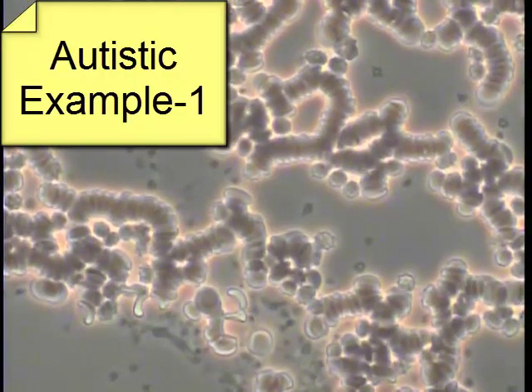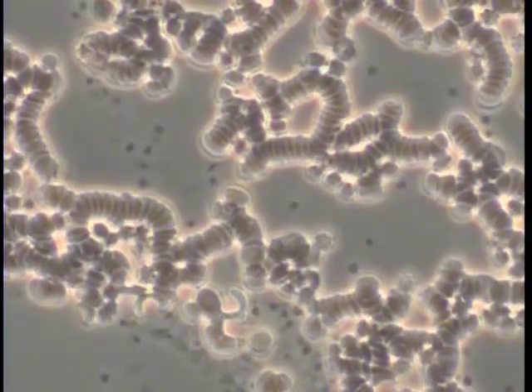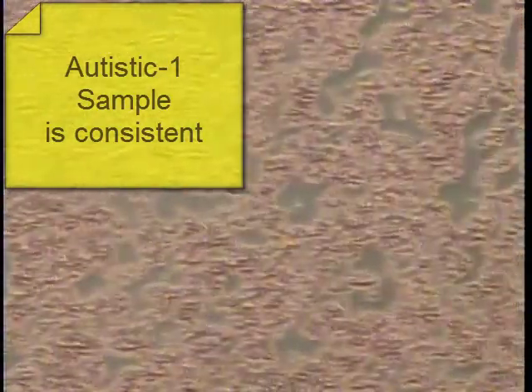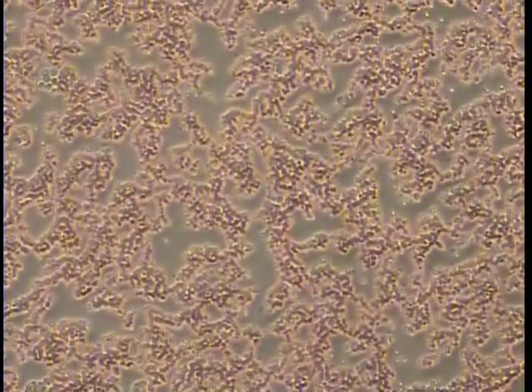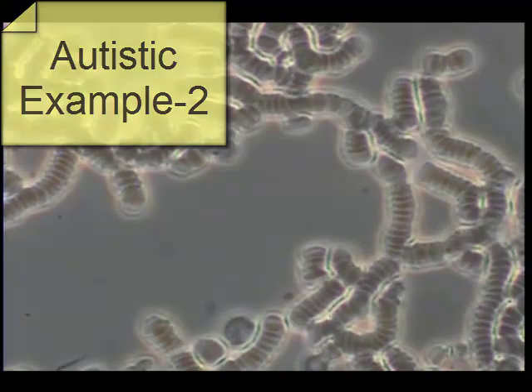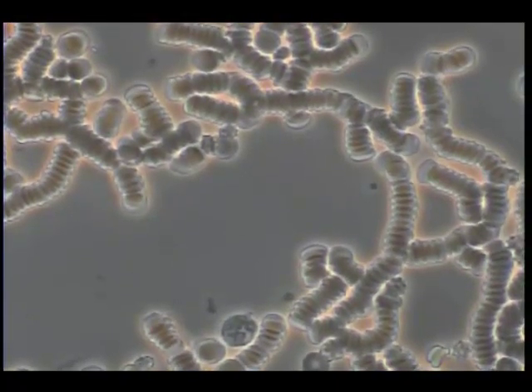This sample illustrates the tendency for red blood cells to stick together like rolls of coins. It also shows the tendency for very high levels of intracellular debris. The entire slide shows that this artifact structure is consistent across the entire sample. Sample 2 shows a virtually identical pattern, with each red blood cell stacked like a roll of coins.